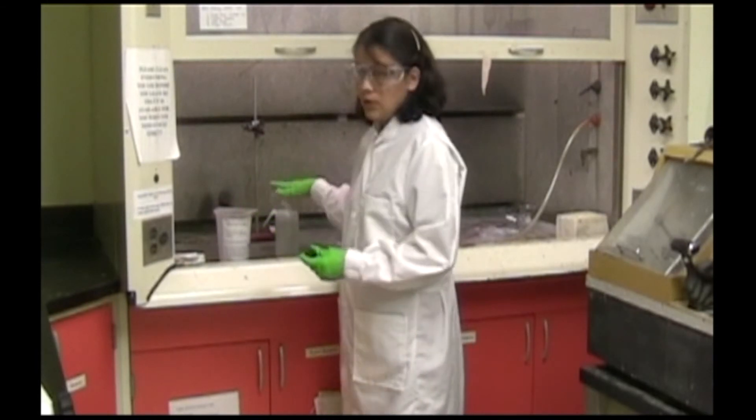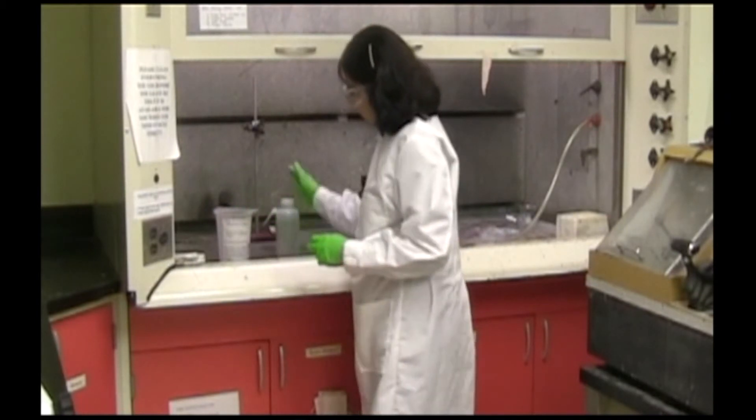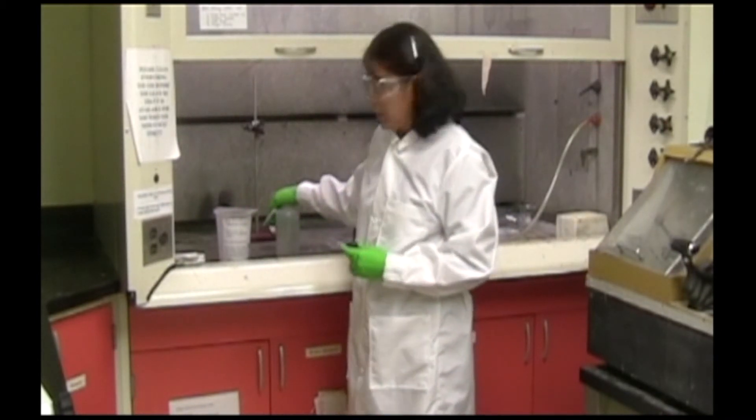And since there is no sink in this fume hood, you can rinse off your sample into this container. This is full of tap water. If you need deionized water, you need to bring that.